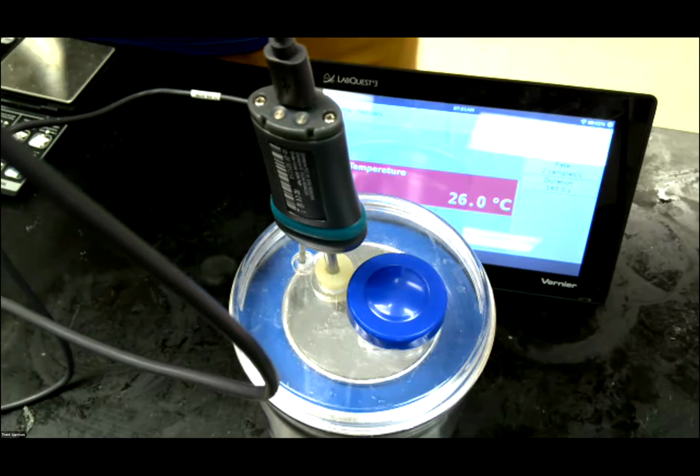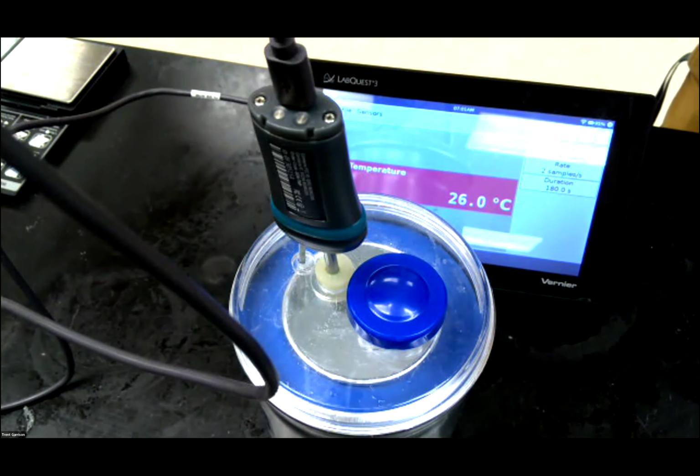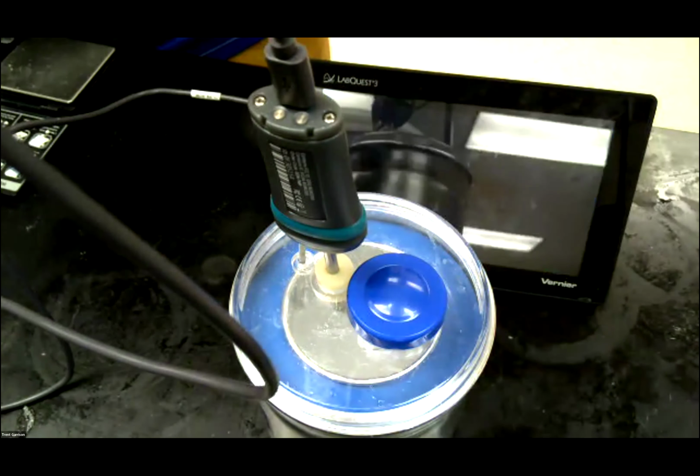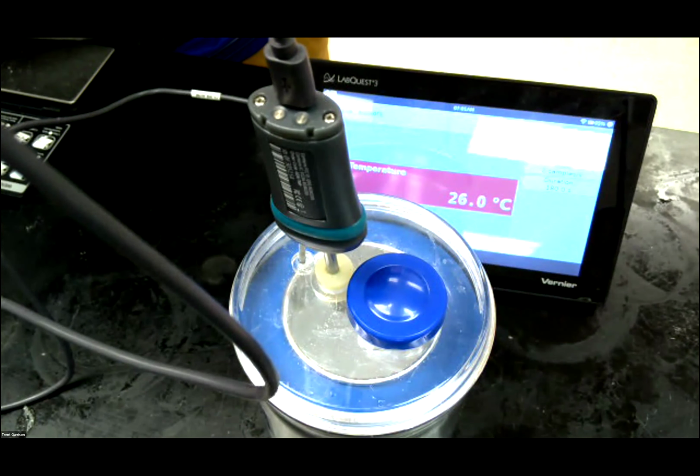All right, it looks like we have stabilized now. We are up at 26 degrees even. So these numbers are coming out nice and round for me. Easy subtraction I could do in my head. All right, so that is going to be the end of part 2. Let's now jump back and see what part 3 has in store for us.